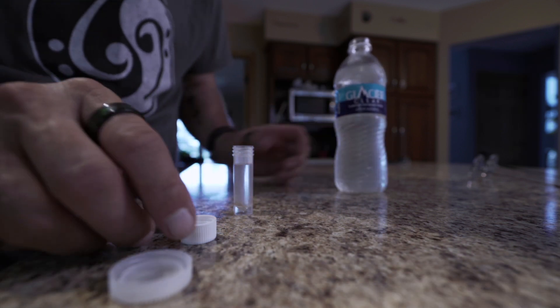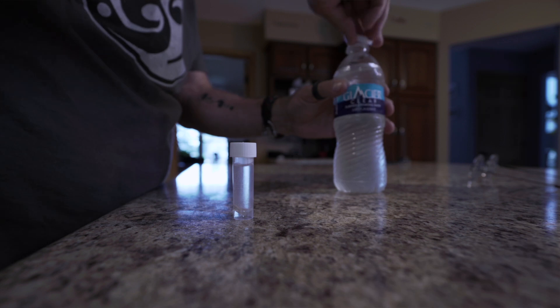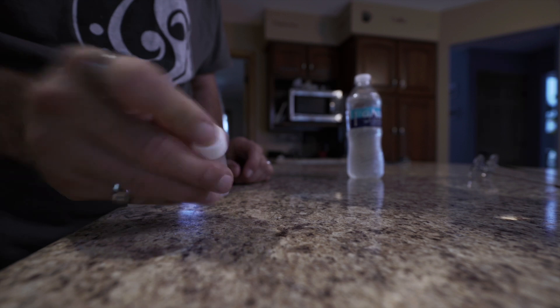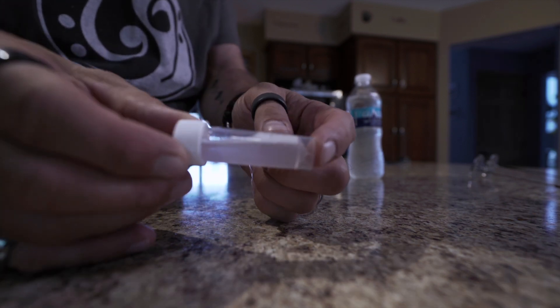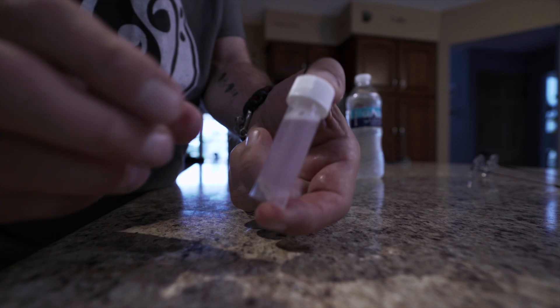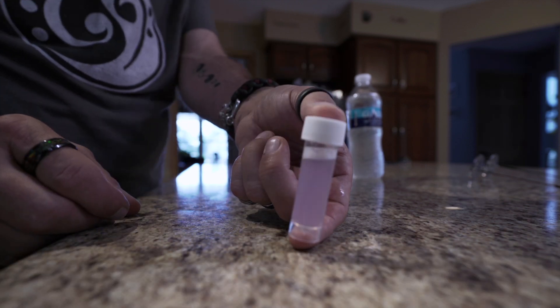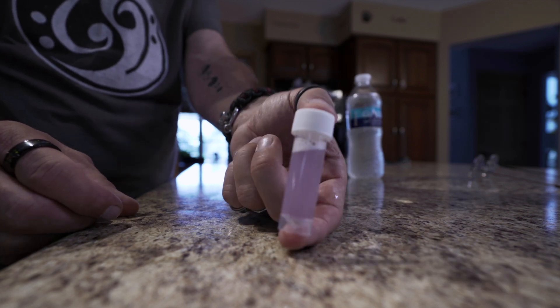The only thing about this test is we've got to wait 48 hours to read the result. We're going to fill it up, shake it up, set it aside, and come back to it in a couple of days. Looking at it now, it looks a little cloudy but it's actually starting to turn purple already — that's a good sign.